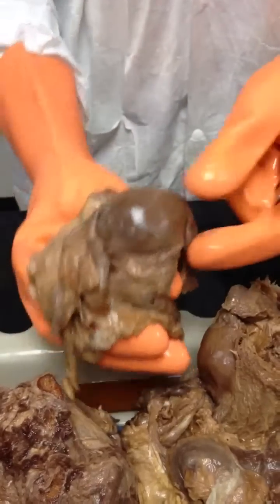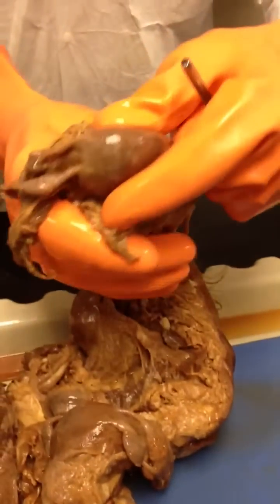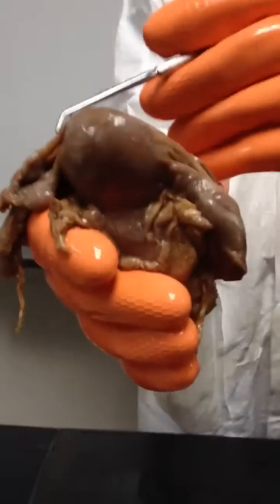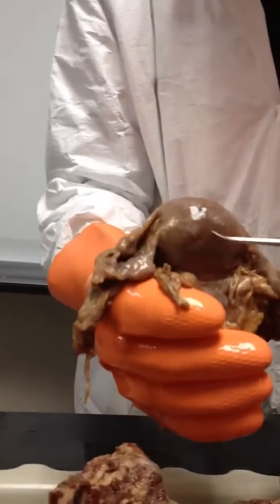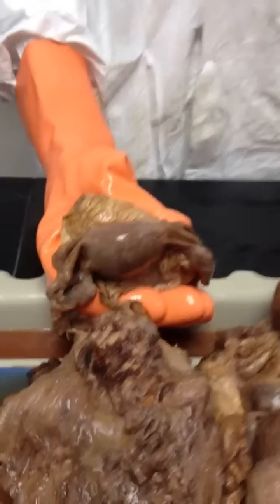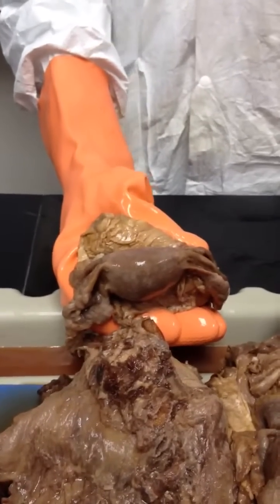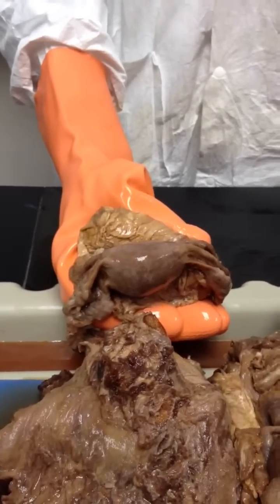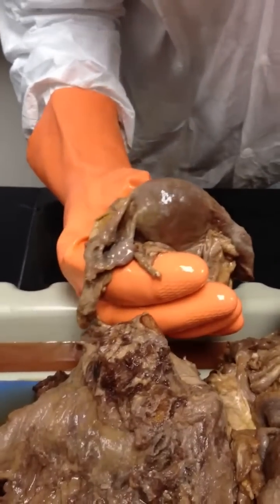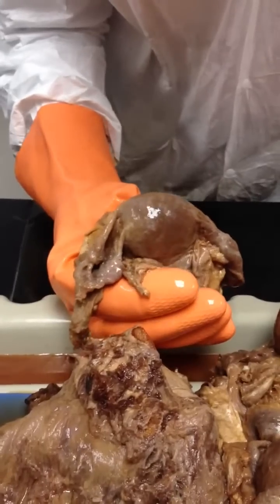And then let's take a look at the same parts on this one. One of them has a more obvious fundus. So I think that's even more convex. Look at that. There's the fundus. That's body, fundus. Now, I think those are labeled in the atlas also, so they can turn up on the quiz, because amongst the images that I'm requiring are pictures of this. Okay, so when you're studying for the quiz, it'll help for this.